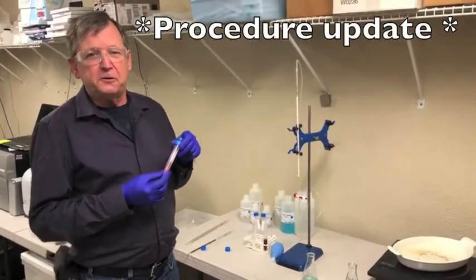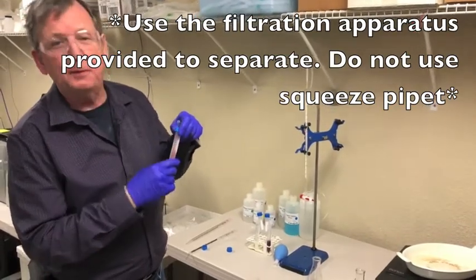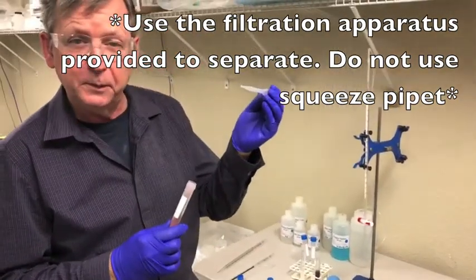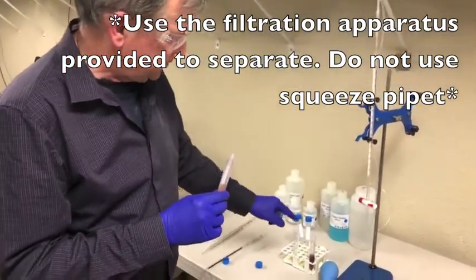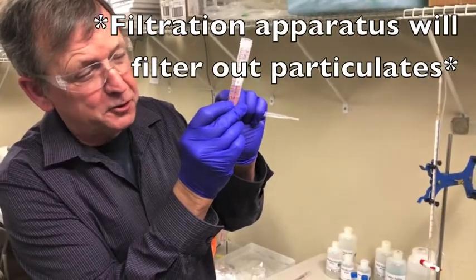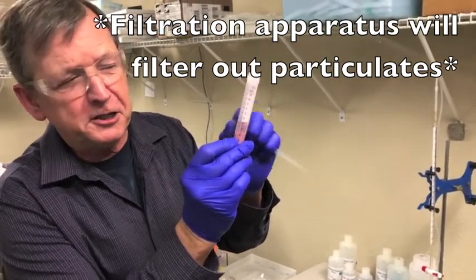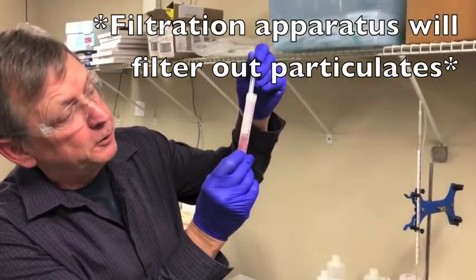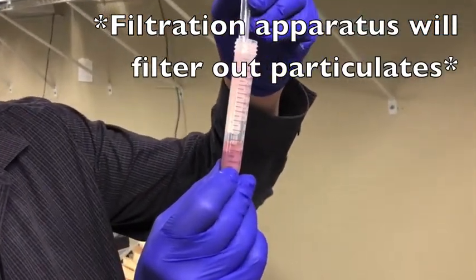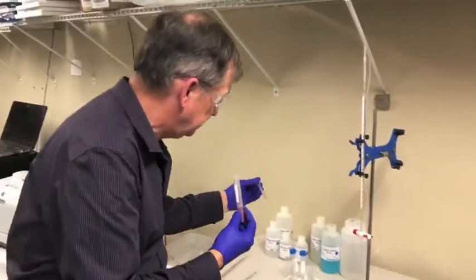Now that we've settled or centrifuged our wine, if you didn't filter, you'll need to take the supernatant off the top of the settled precipitate. We suggest using the little squeeze pipettes provided in the kit and transferring it to a separate tube. You really don't want to disturb the settled precipitate, as getting it into the sample will cause inaccuracy. Very carefully remove all the material with minimal disturbance to the precipitate, and get the two milliliters you need into a fresh tube.